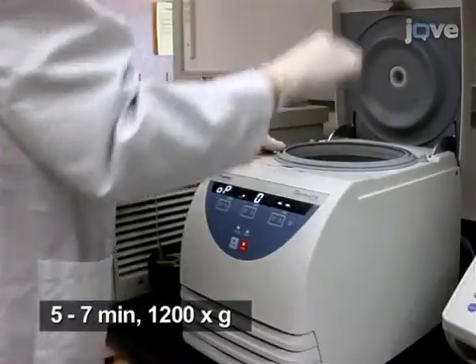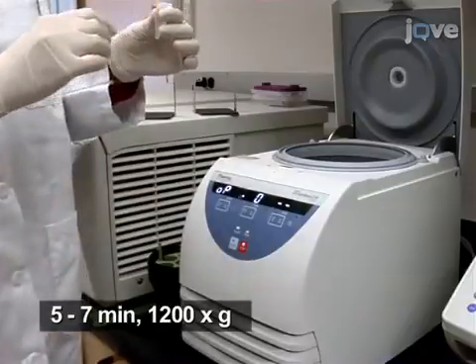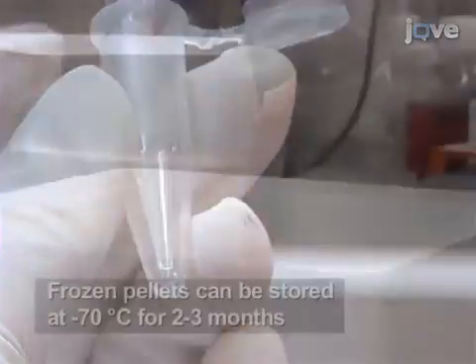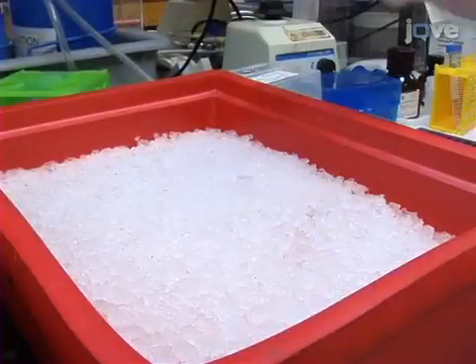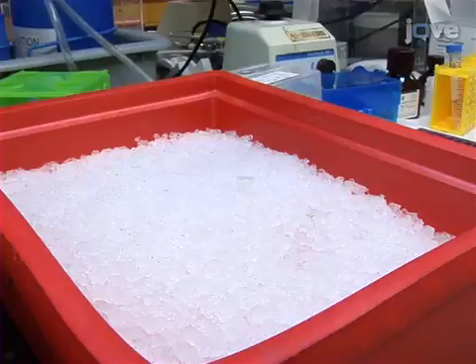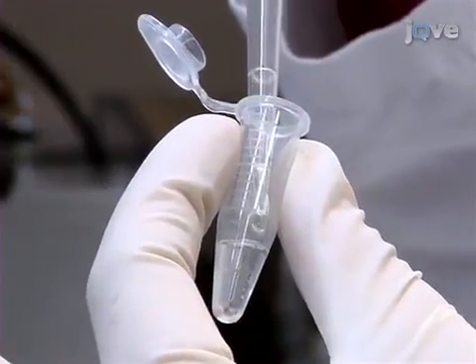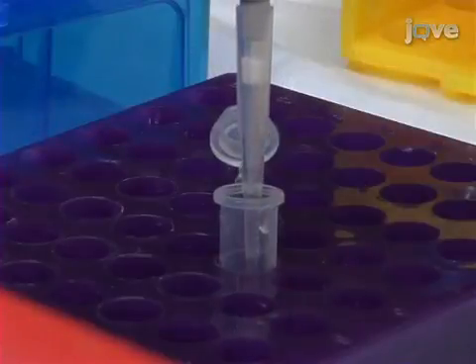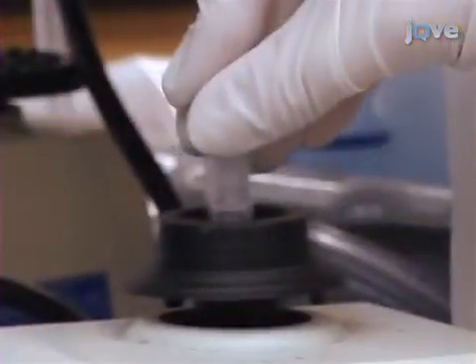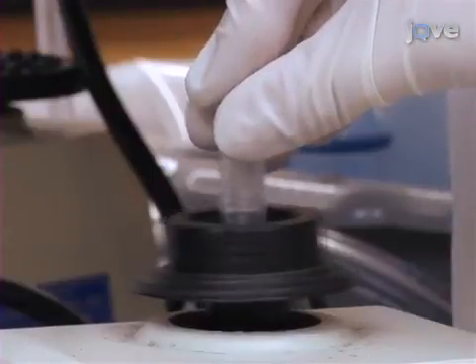After spinning down the sorted cell populations at 1200 times G for 5 to 7 minutes in a microcentrifuge, carefully remove the supernatant and freeze the cell pellets on dry ice. Next, transfer the frozen cell pellets to regular ice for thawing. Add 300 microliters of lysis buffer from a mirVana kit, and then gently mix the cell solution by pipetting 5 to 7 times. Then add 30 microliters of the homogenate additive, vortex the cell suspension for 30 seconds, and then place the tubes on ice for 10 minutes.